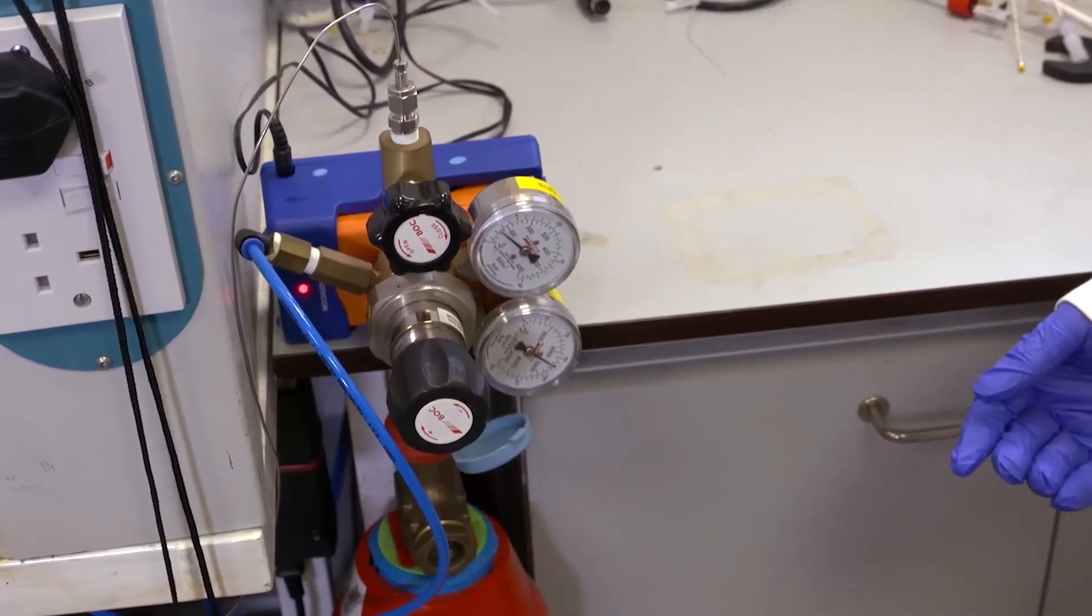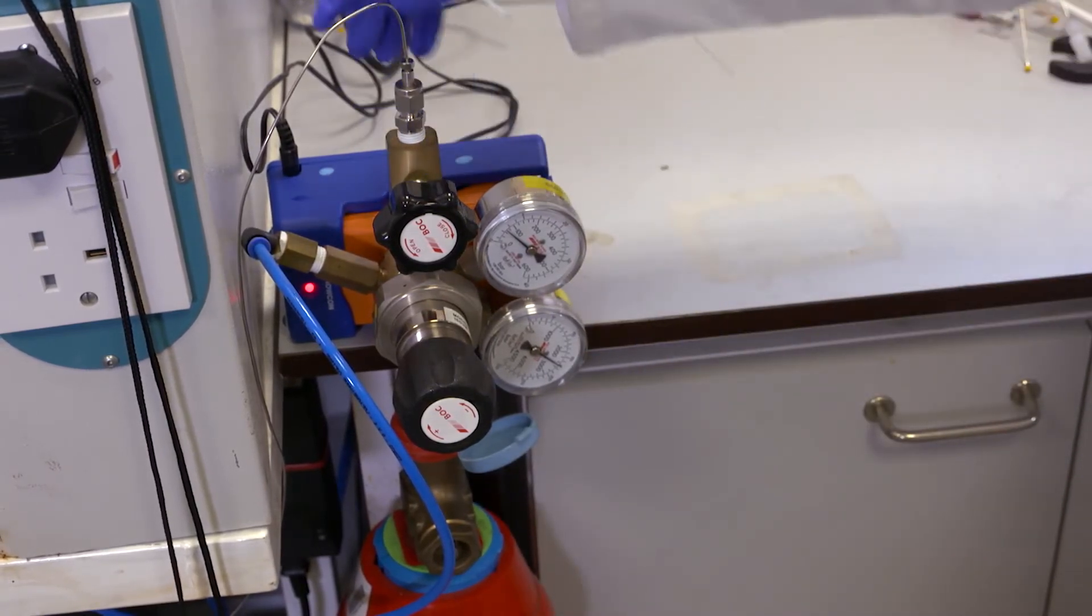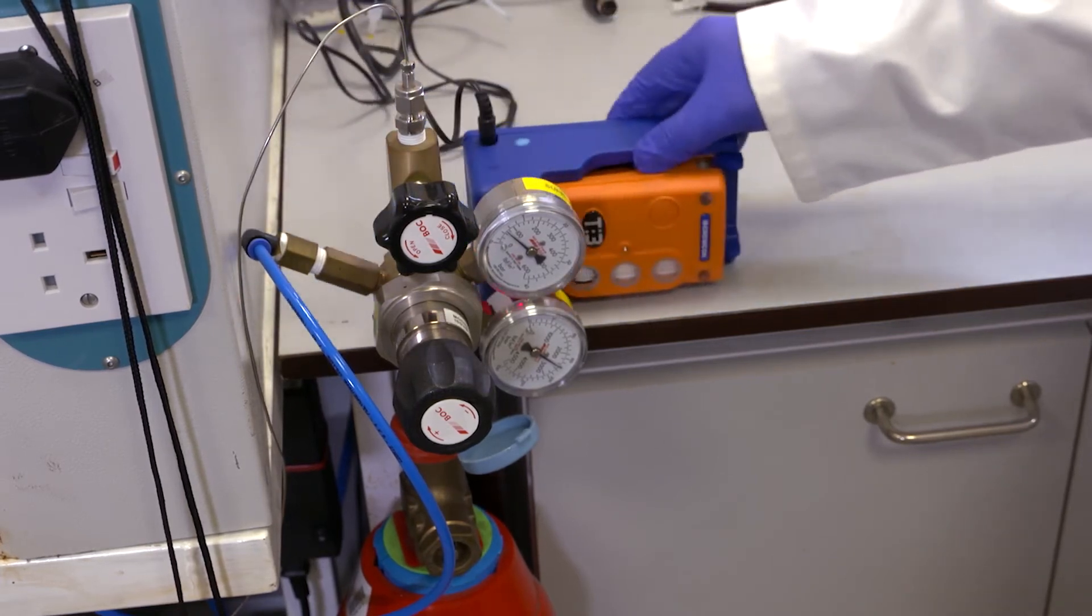Using gases with the E-Series is easy. I'm using just a standard hydrogen cylinder and a regulator which is set to 5 bar. The output goes to the inlet of the V3 pumps and I have a detector and alarm for safety.